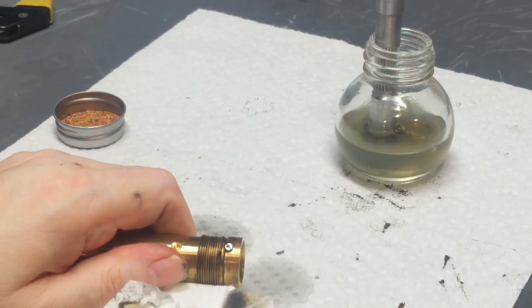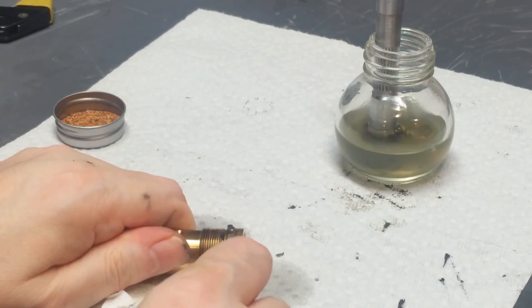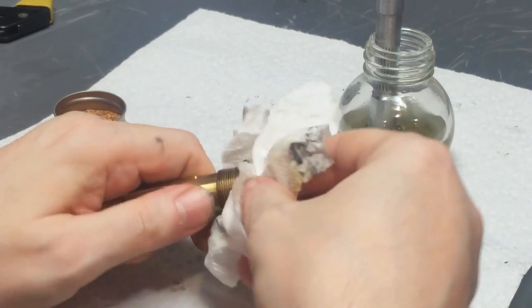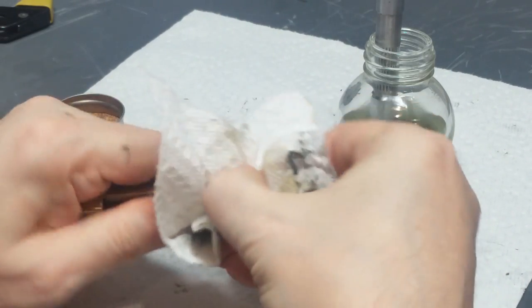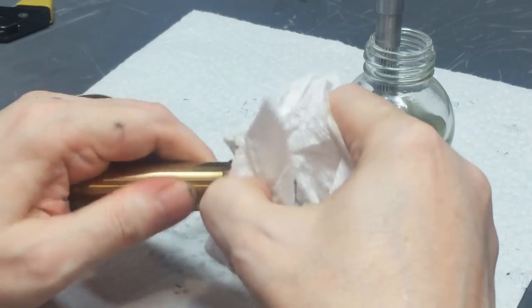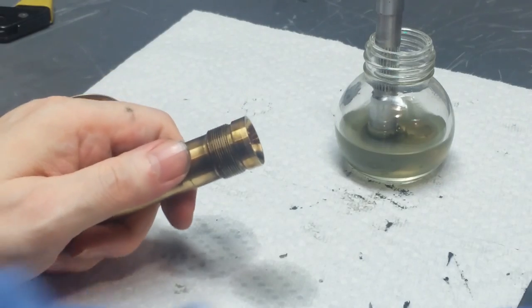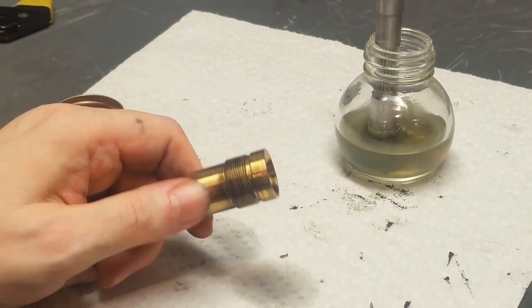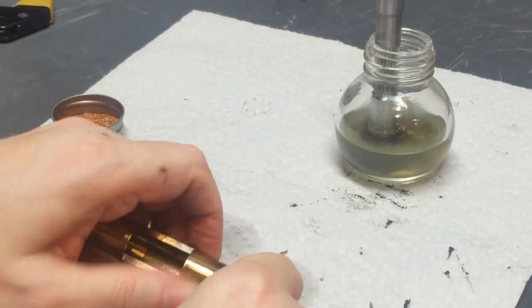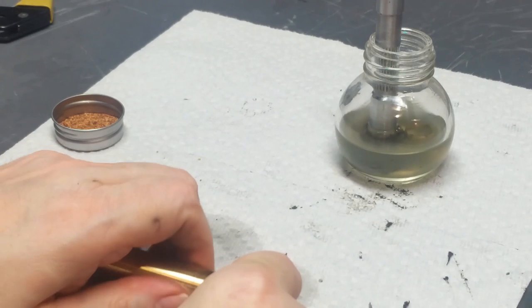As you can see, cleaning this dry grease, it's almost wax, and maybe even harder than wax in a lot of cases. Cleaning this stuff off just takes some elbow grease, solvent, sometimes heat, and a fair amount of work. It's not pleasant work, it's a mess, and the stuff smells disgusting, but it does have to come off. As far as the threads here, these are left-hand threads, by the way. So everything you think you know about threads gets reversed here.